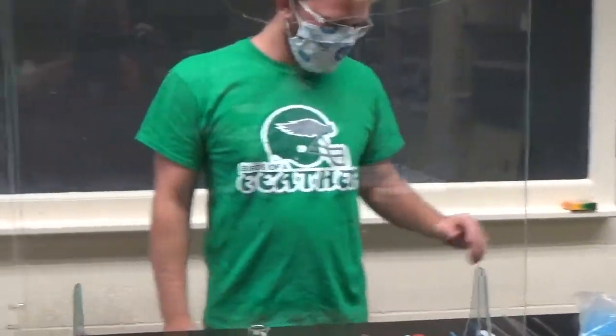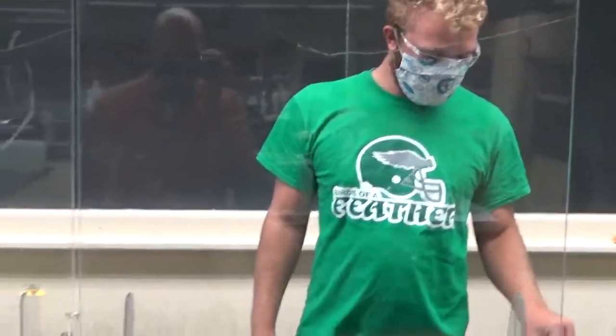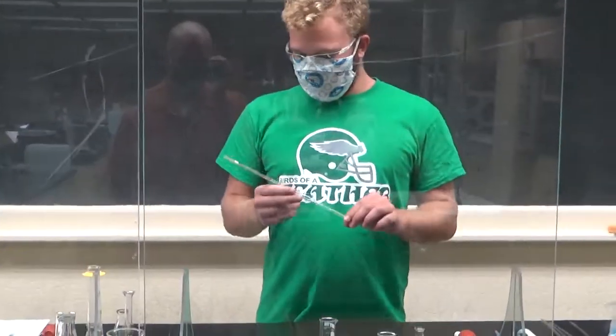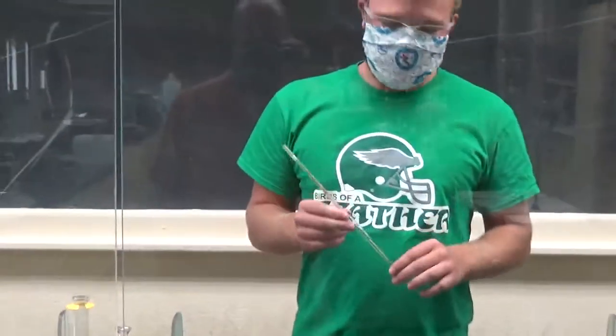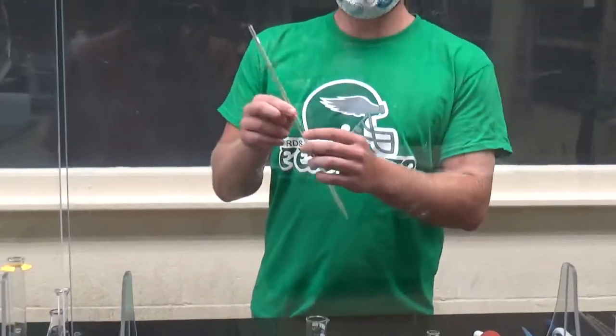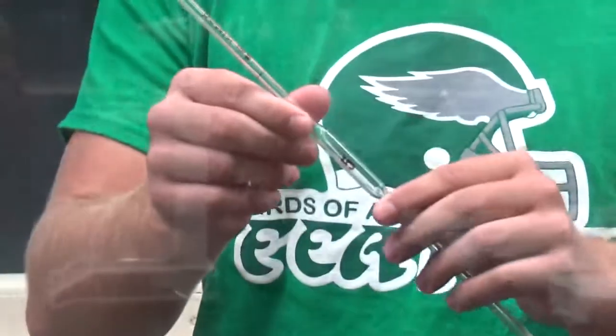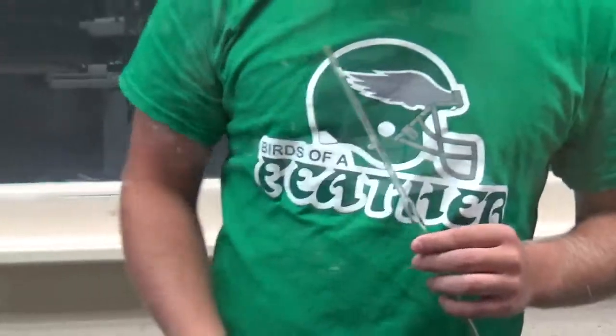There's three different pipettes. I'm just going to let Wes take it away here and I'll zoom in, zoom out, maybe ask some questions. So here we have a volumetric pipette. You can see it says it's a five milliliter pipette. I can zoom in on that. There we go.